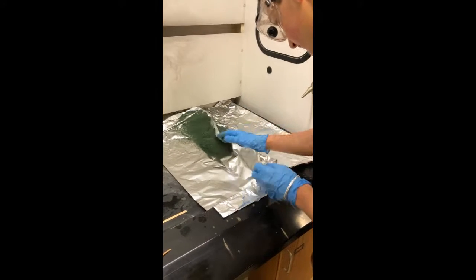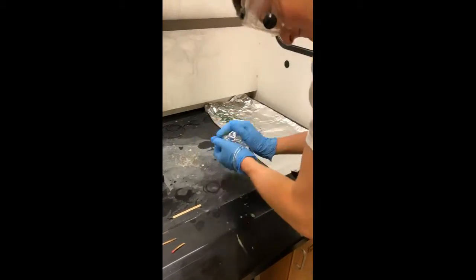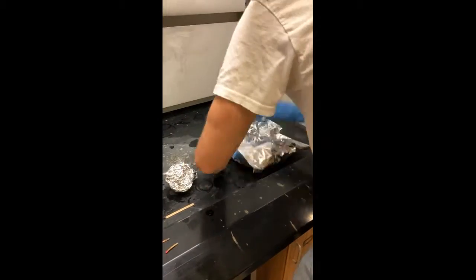We then perform the reaction with more ammonium dichromate than before, and also in the dark. We then carefully cleaned up and disposed of the chromium-3 oxide. I made sure to wear gloves because chromium-3 oxide can irritate the skin.